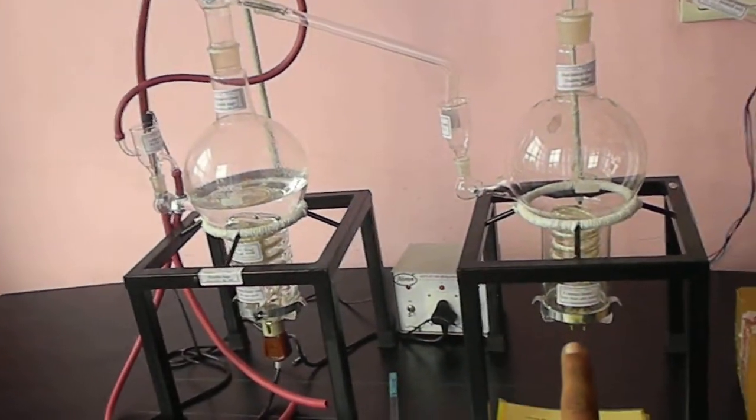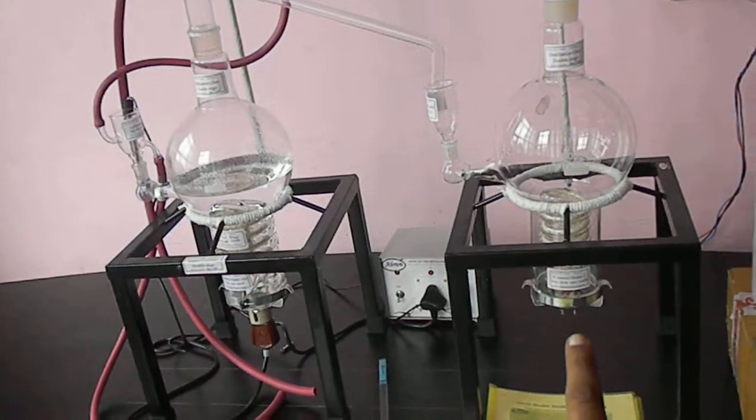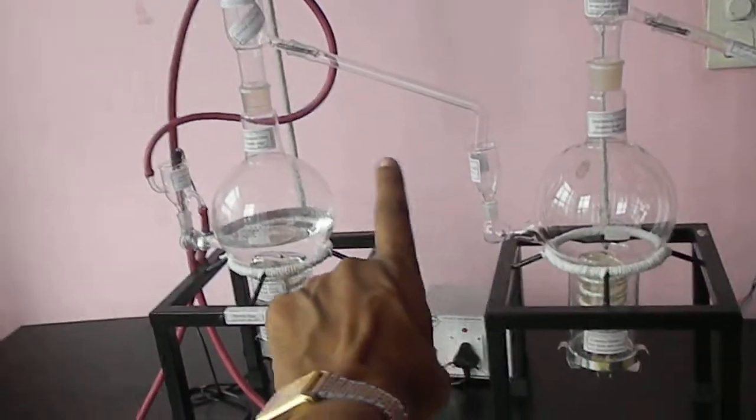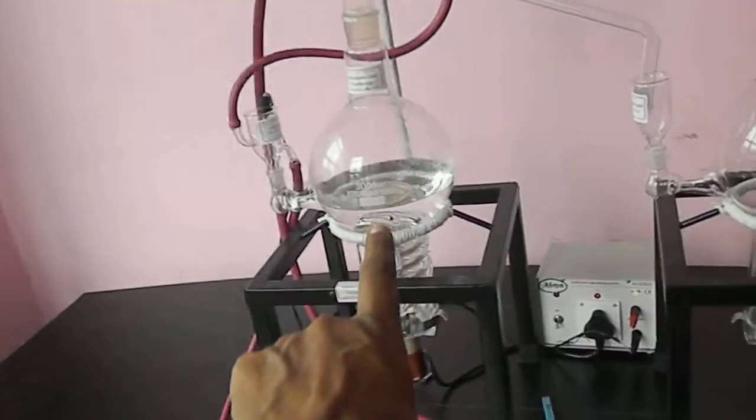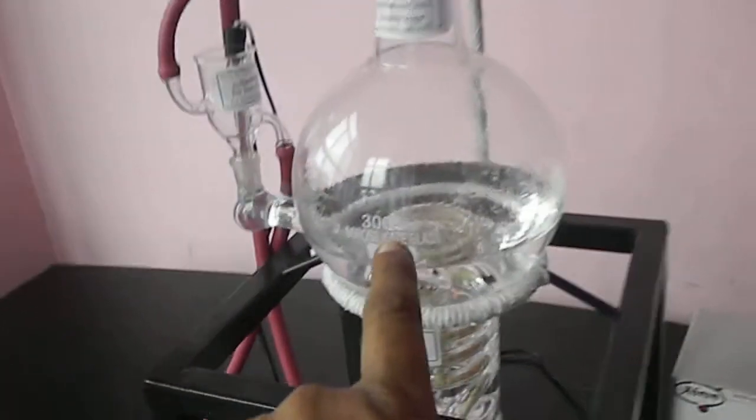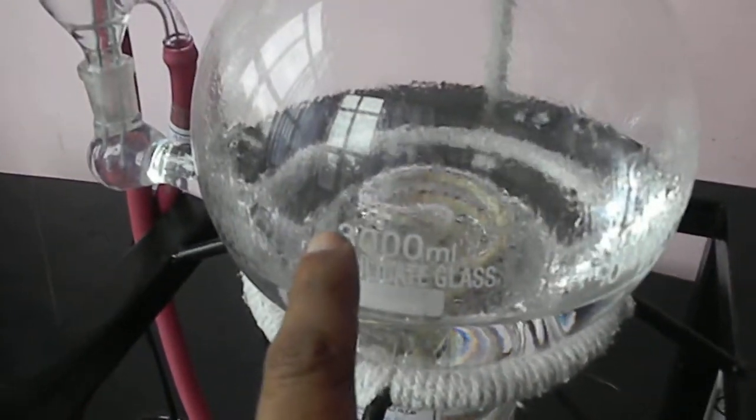And that will be connected to this section. I am not connected yet. Because once the water is coming, this distillation is now bubbling. You can see the heater started bubbling. Now you see this bubbling is going on.